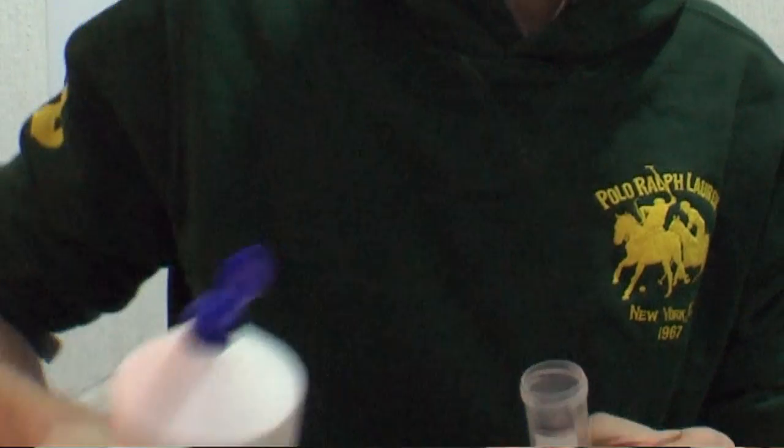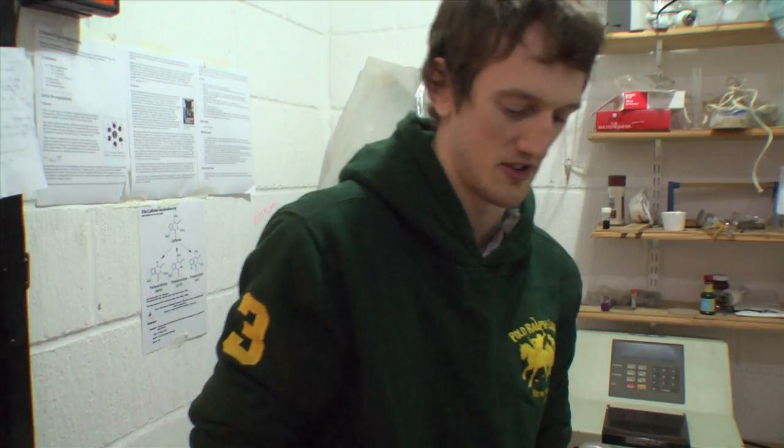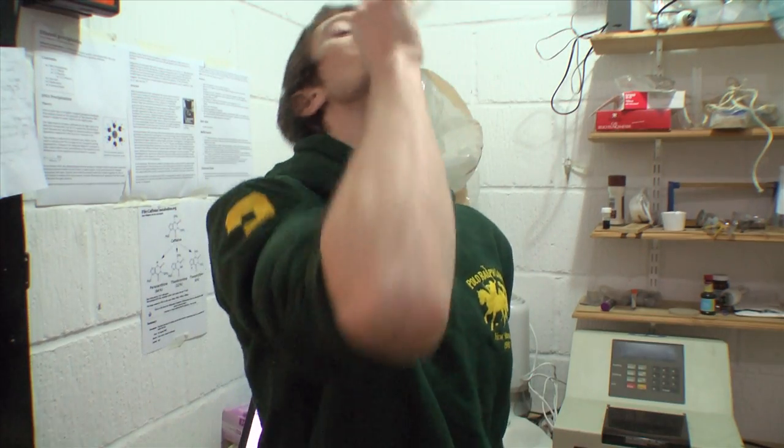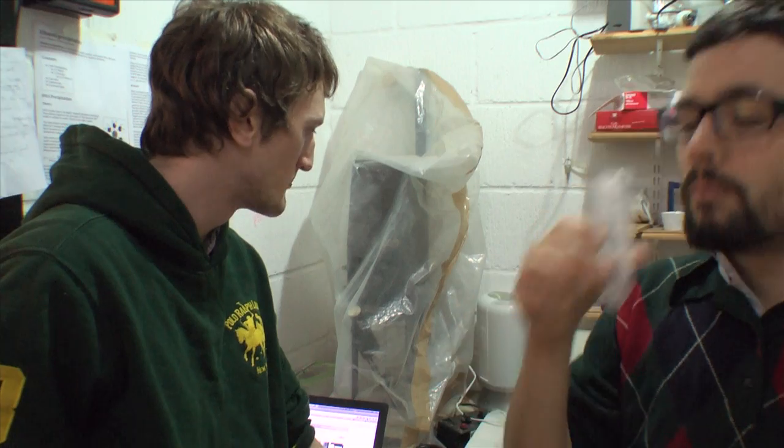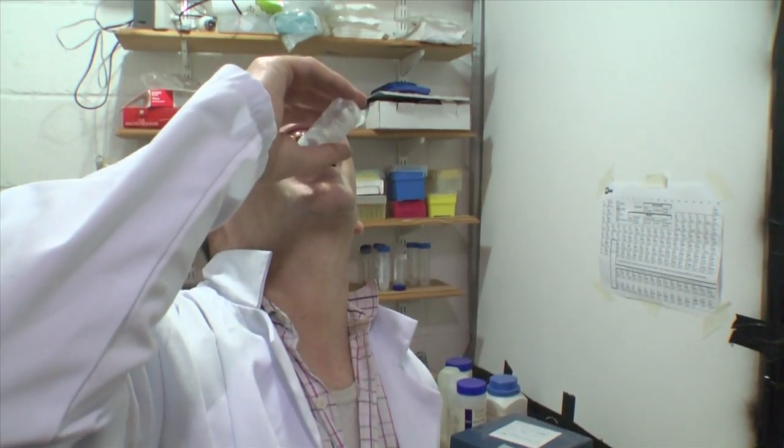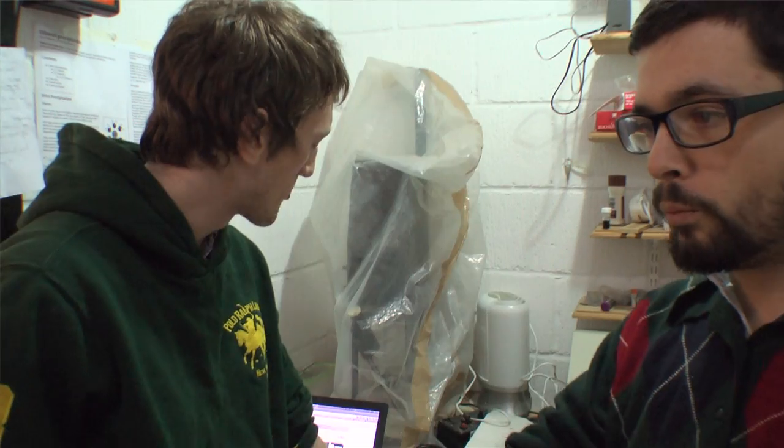To get the DNA, we'll be doing a cheek swab. So we just take 10 mils of water, vigorous cheek chewing and swishing, make it bleed.